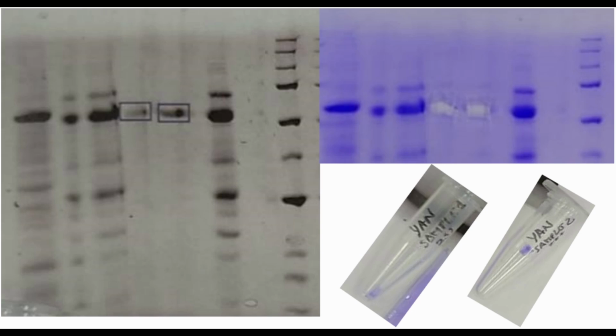To this purpose, the final sample is loaded in acrylamide gel, later stained with a Coomassie stain. The stained band or bands are cut from the gel and kept inside a tube that can be frozen at -20°C until the moment of the analysis.